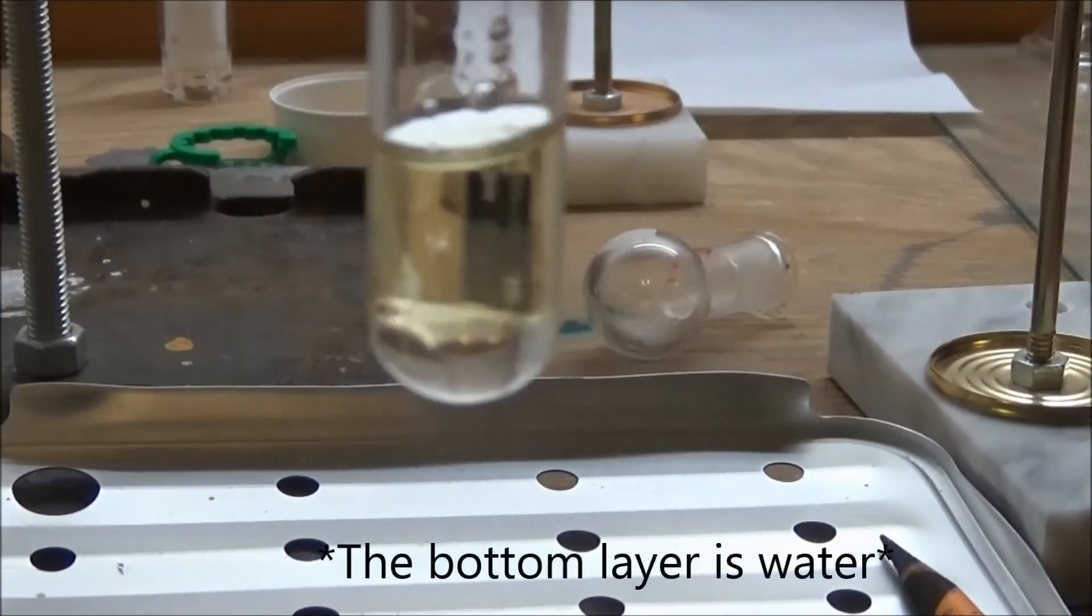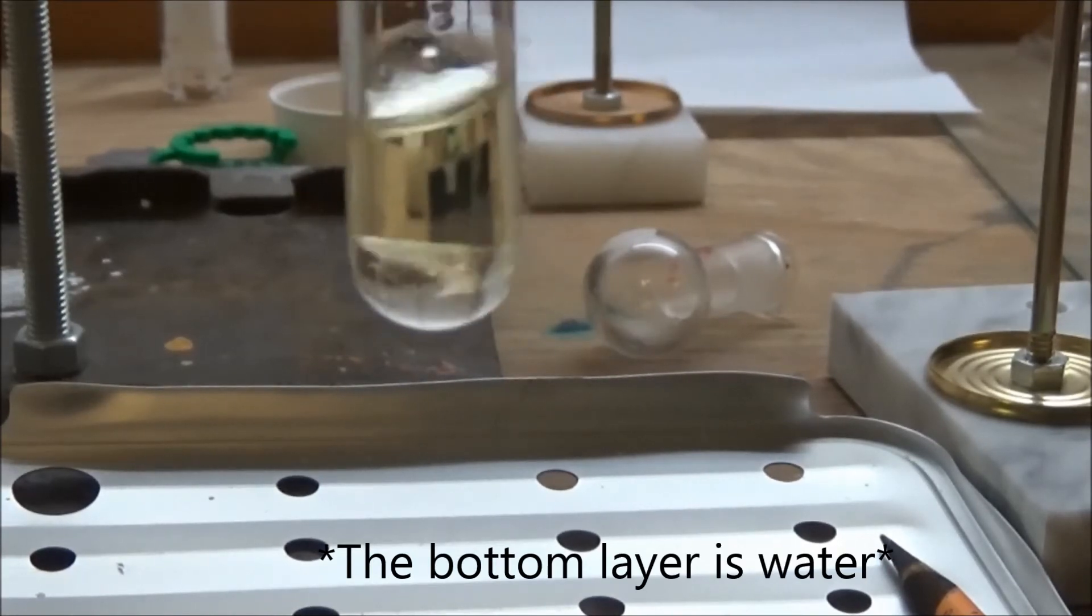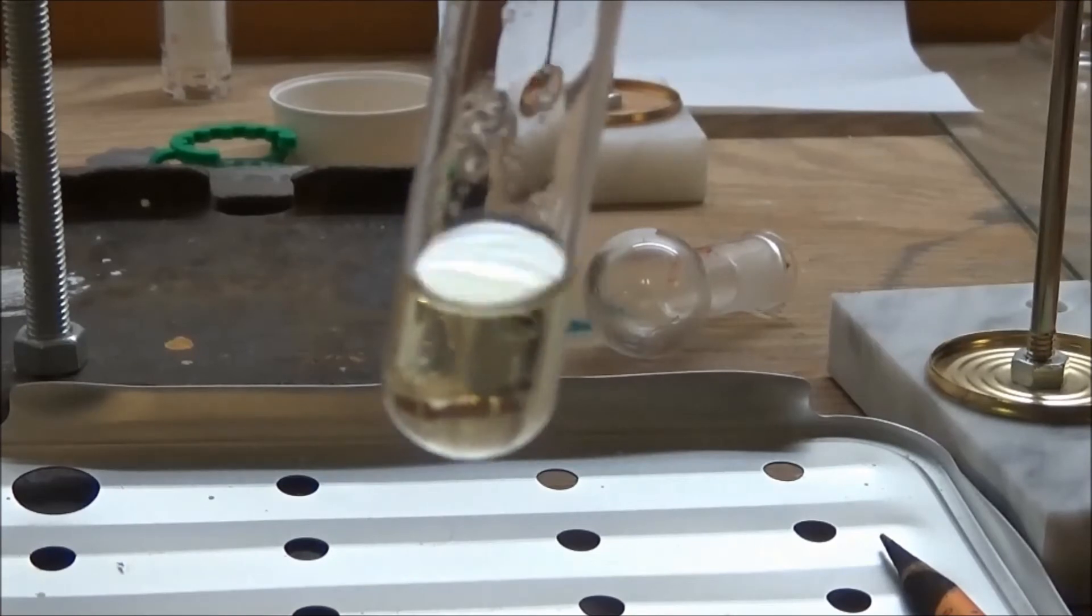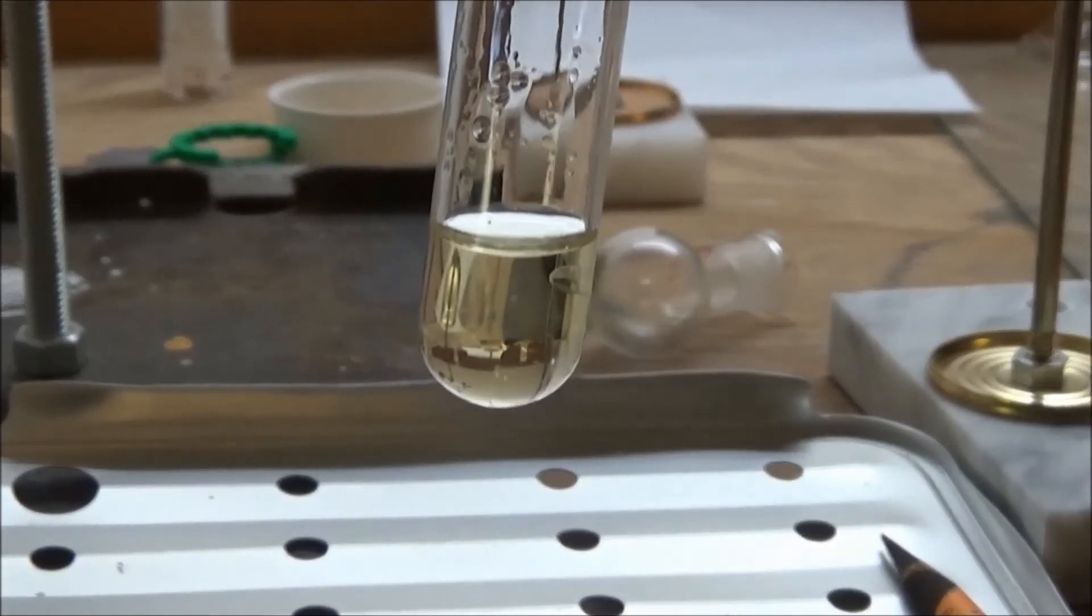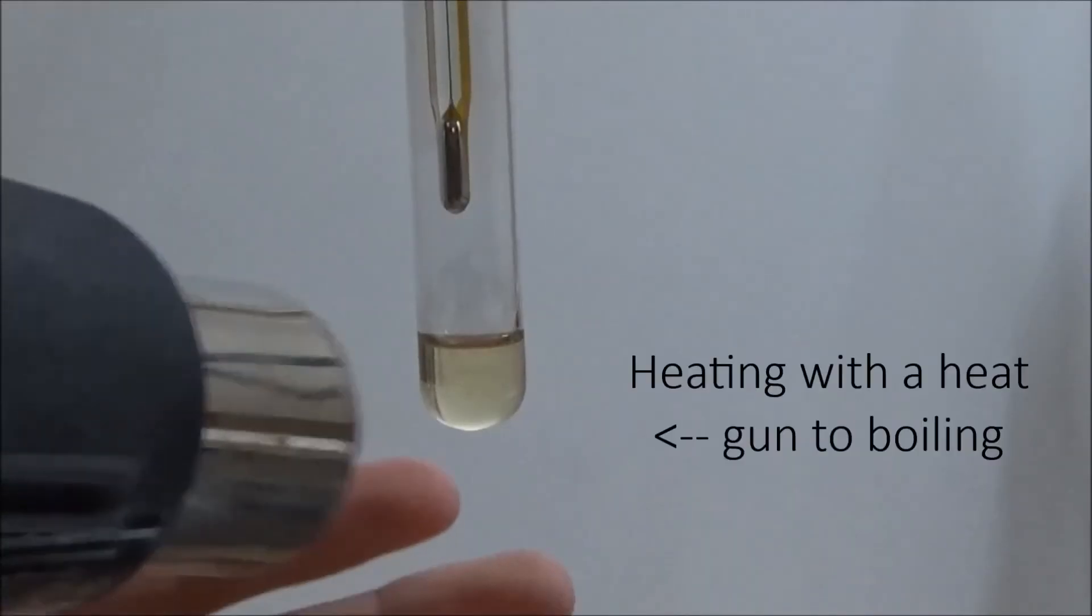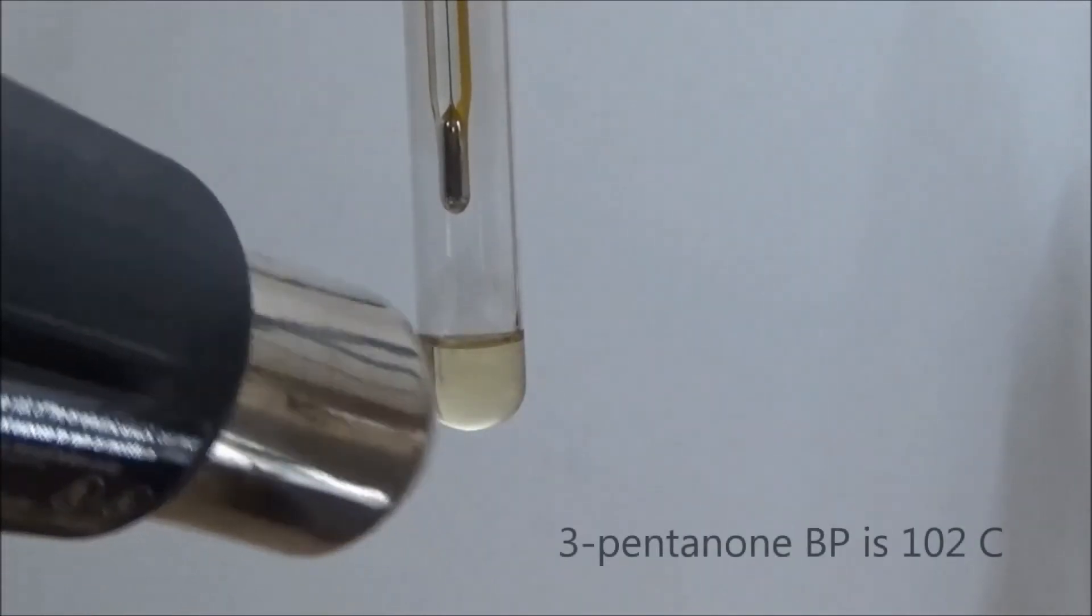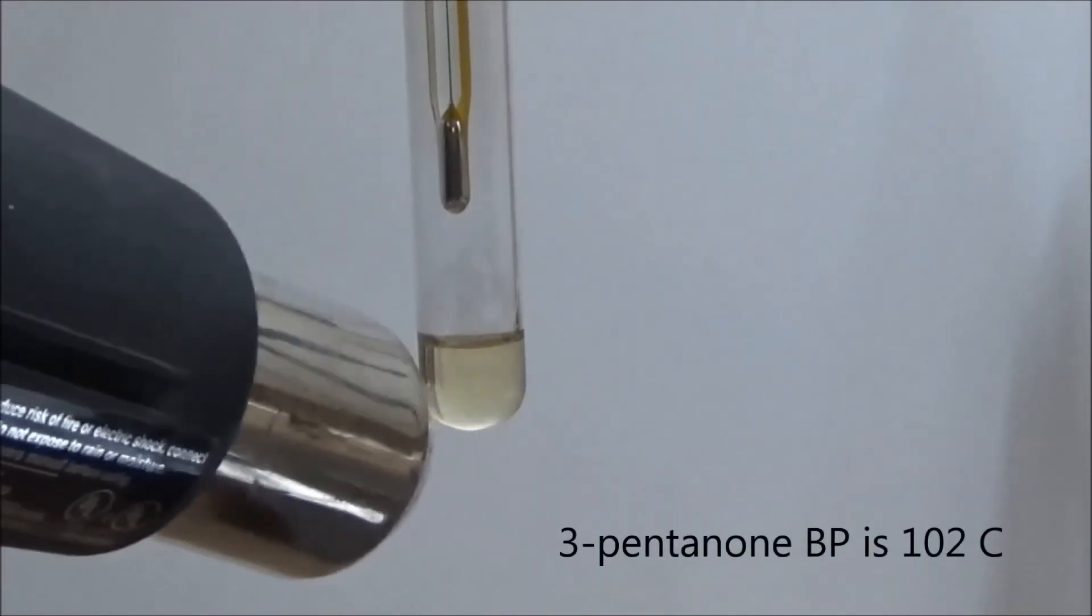You can see that the distillate separated into two layers. I removed the bottom layer with a pipette and dried the remaining liquid. Using this setup I found the boiling point to be 101 degrees Celsius, which is only one degree below the literature boiling point.